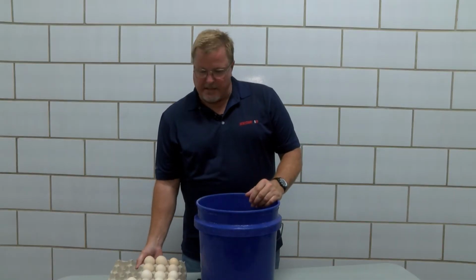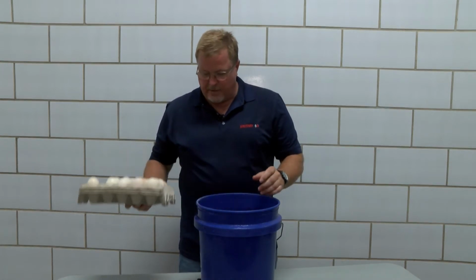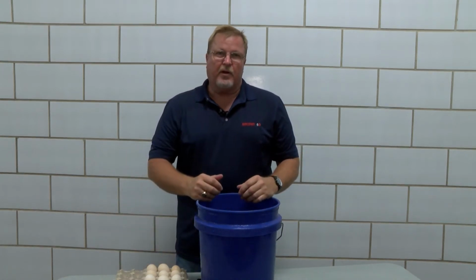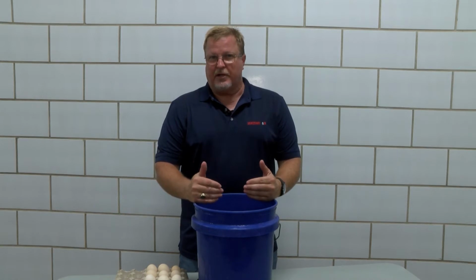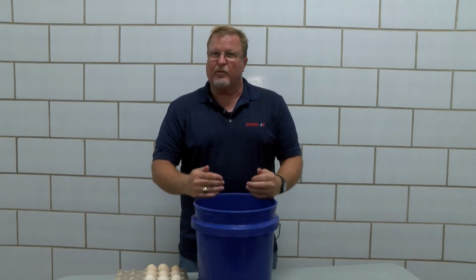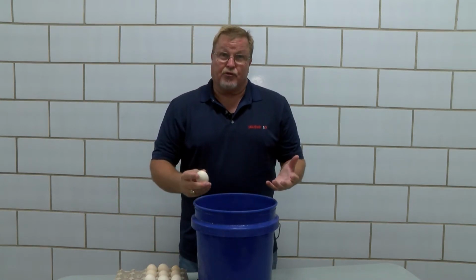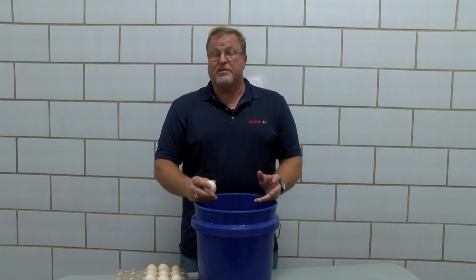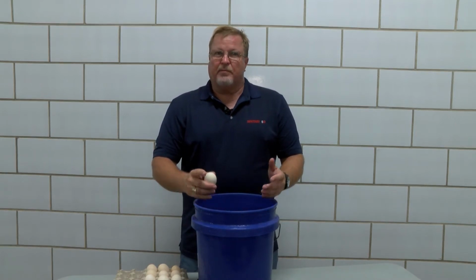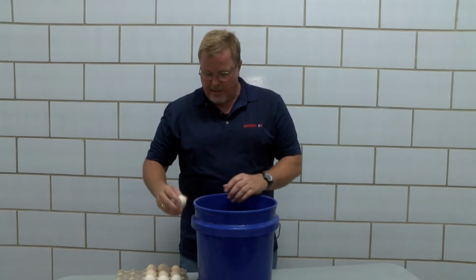Okay, so once we get the eggs out of the incubator and we've loaded them on our flat, we bring them out to a place that we can further examine the eggs. Because again, just because we pulled it out and it looked like a clear egg does not mean it's an infertile egg. We call it an unviable egg. So this is how we would assess and get our true fertility, or our real fertility. Again, fertility can be determined on a hatch residue breakout as well. But some people will like to assess that in the machine at a little earlier point in time.